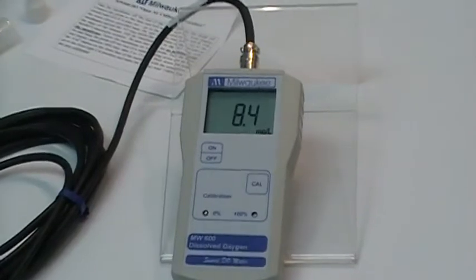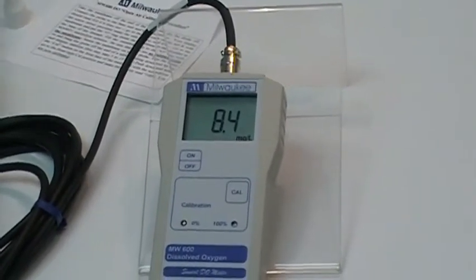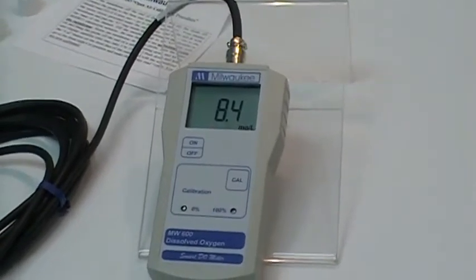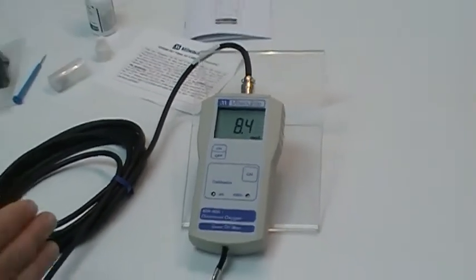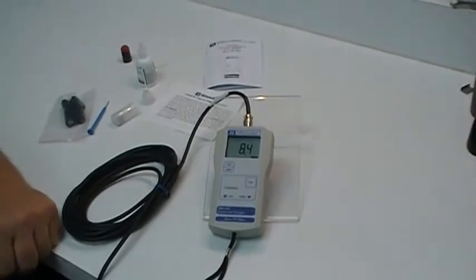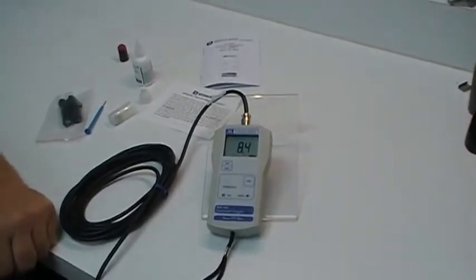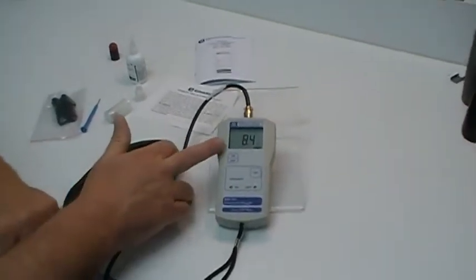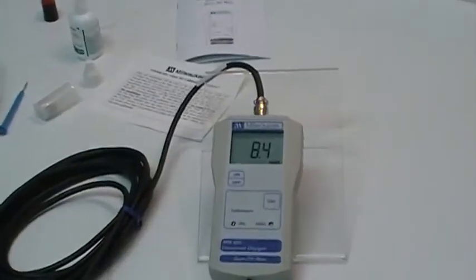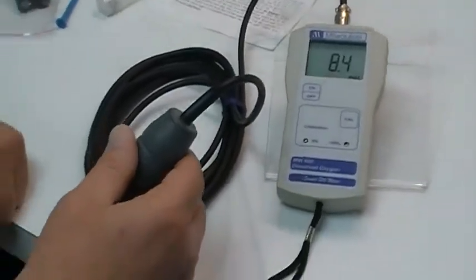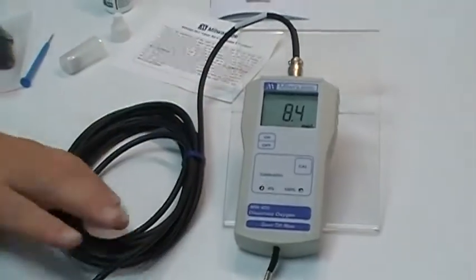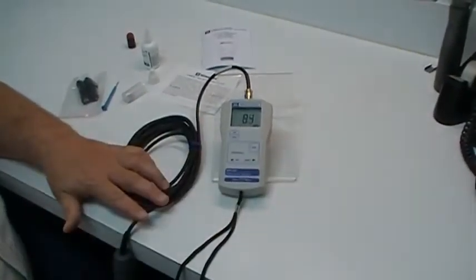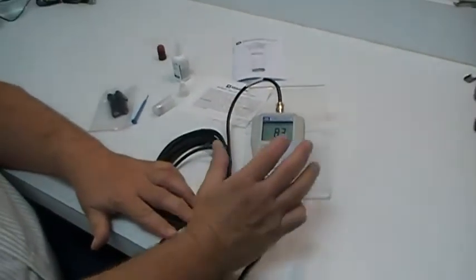We're only 165 feet above sea level. Therefore that is the norm for us here in this location. Every time you turn this instrument on, unless something has changed, like you've moved locations and you've gone up or down in altitude, you should always see that number when the probe is exposed to the open air and that number should be the standard that you go by. If you do not have that number, then you need to go back and start your recalibration procedure again.